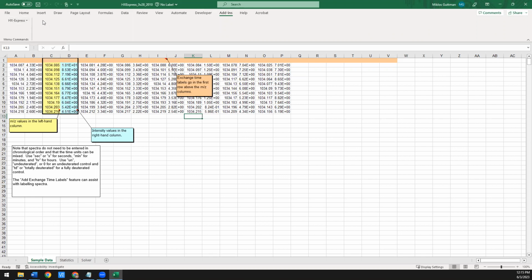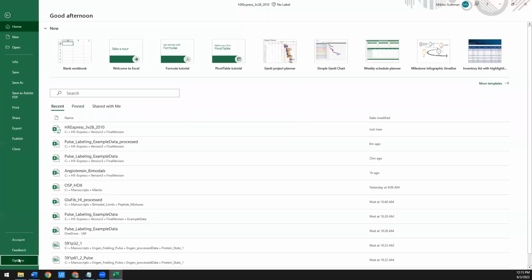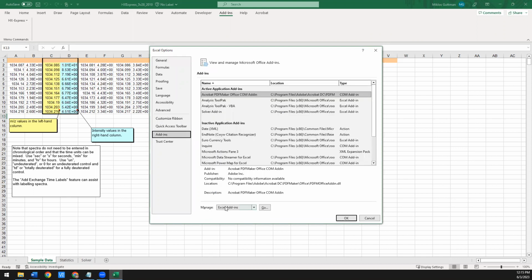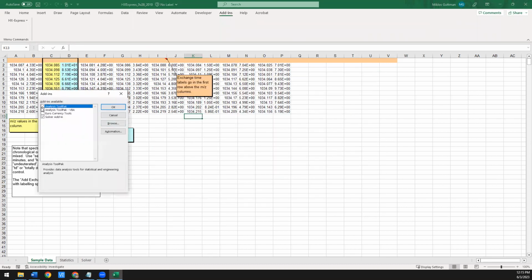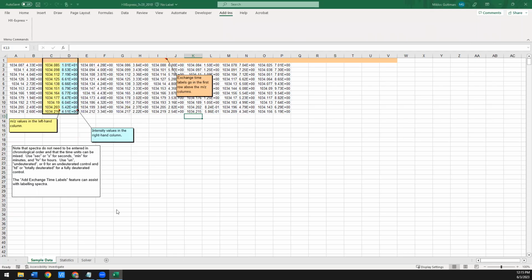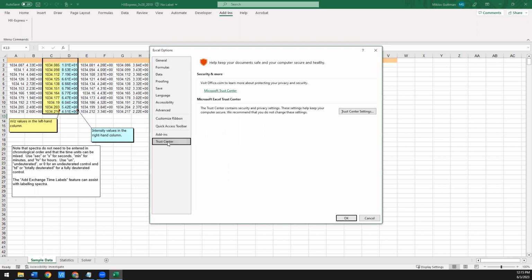If you don't see it, there's a few things you may have to do. So first off, if you go to File, Options, we have to make sure we have enabled some add-ins. So under the add-ins option here, if you go at the very bottom, Manage Excel Add-ins, Go, you have to make sure that you have the analysis tool pack, the tool pack VBA, and solver all checked before any of this will work.